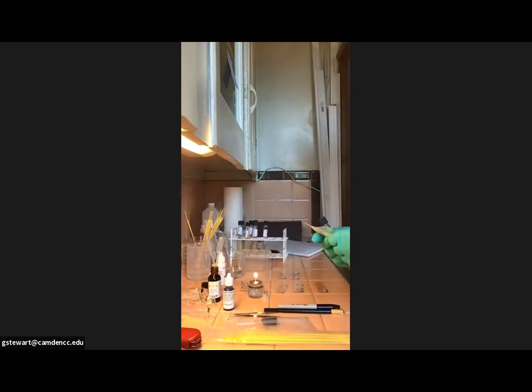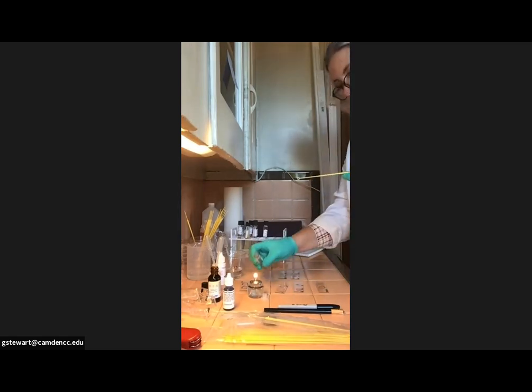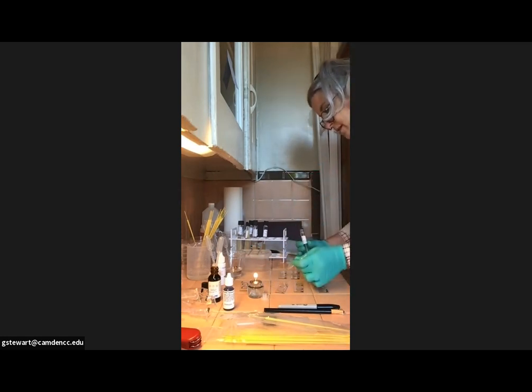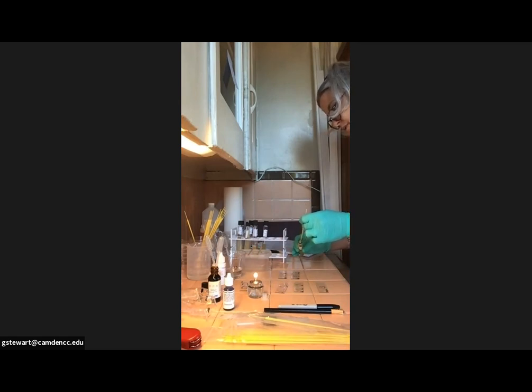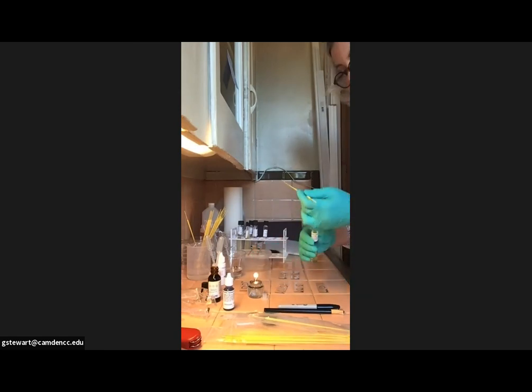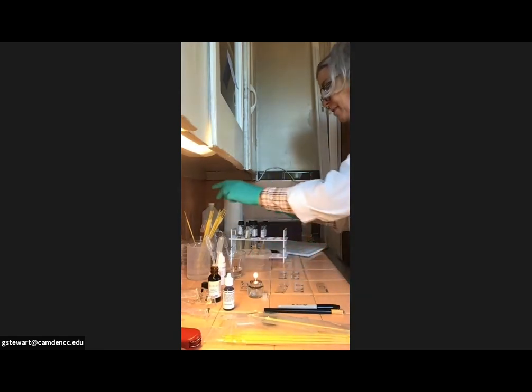And I'm going to use second to last loop from bag number 1 here. And Micrococcus luteus is going to go into the last 2 that aren't smeared already. So Micrococcus luteus, I'm going to put that here in B. And I'm actually going to put 2 loopfuls on there because it didn't grow as well. And Micrococcus luteus on my first of slide 2B. And again, I'm going to put 2 loopfuls on. Try to get 2 loopfuls mixed in there. Flame, close, put that in there.